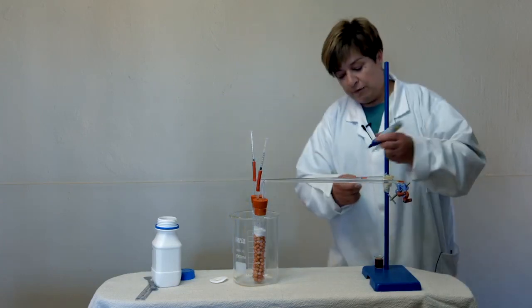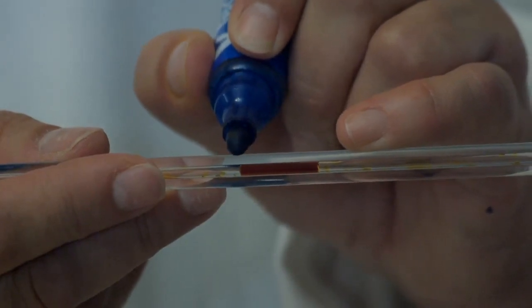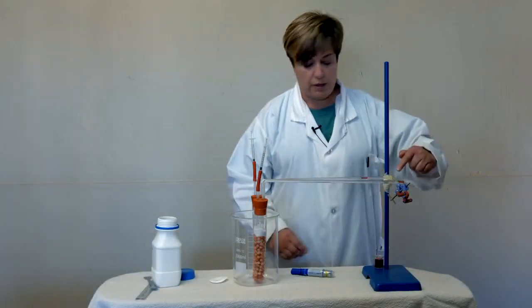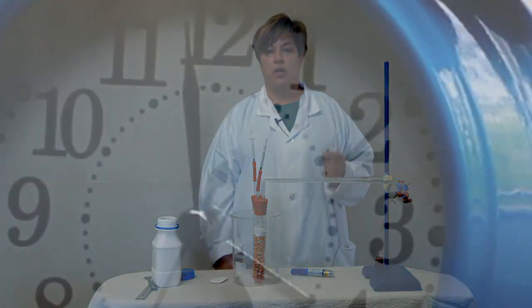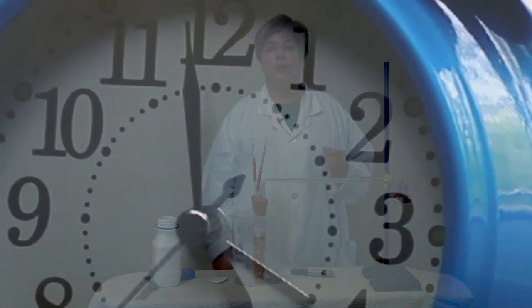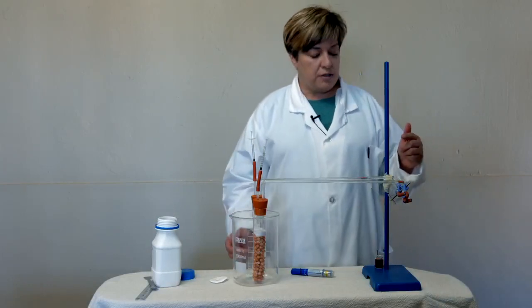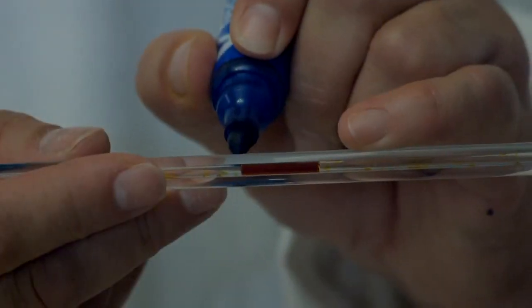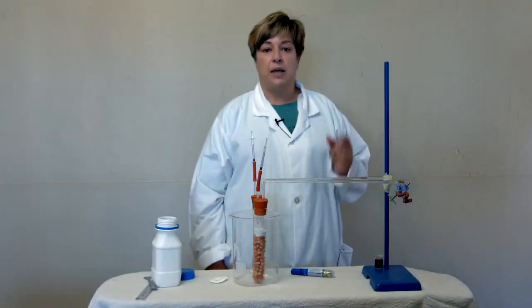And then this one would have been calibrated already, equalized, and we are going to take our marker pen and we are going to make a mark where the droplet is. Now, as soon as we see this droplet in the one with the experiment, the one with the pea seeds, starts to move, then we start to time, because remember, we are going to determine the rate of respiration. And depending on how fast the movement is, we will make a mark every 30 seconds or every minute. And each of those will then count as a measurement.